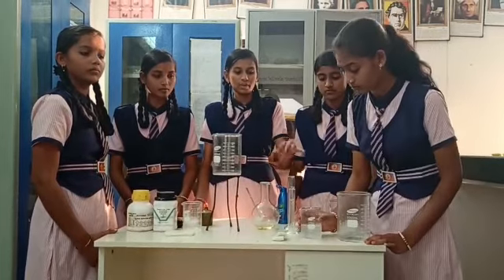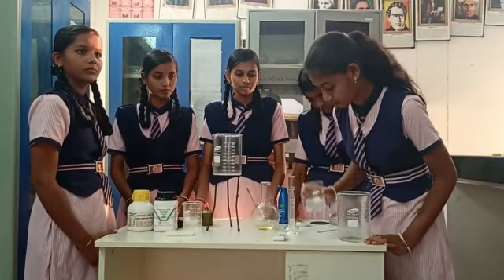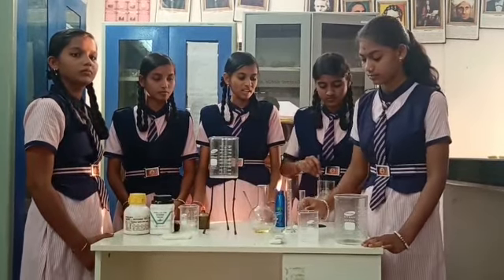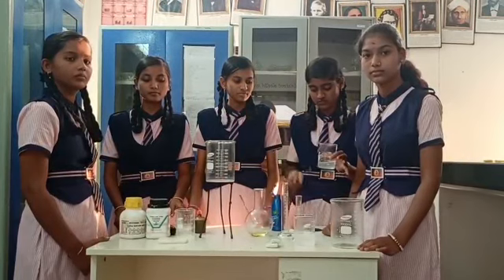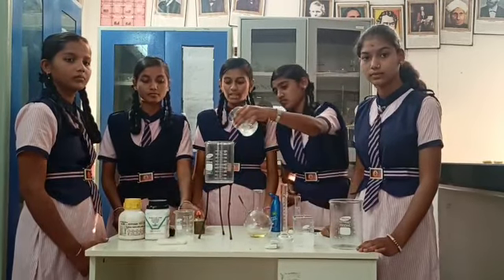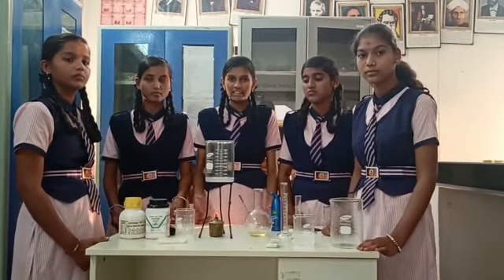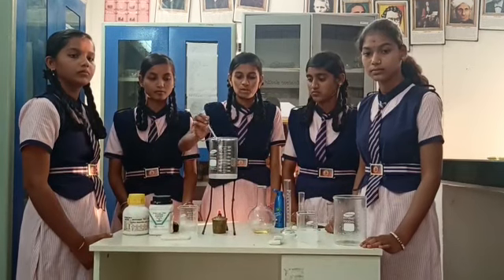Take 10 ml of solution from the 100 ml solution. Add 19 ml of Coconut Oil in the solution. Stir well. Heat the solution using the Spirit Lamp. The solution is boiling. At that time, add 0.5 gram of Sodium Chloride.